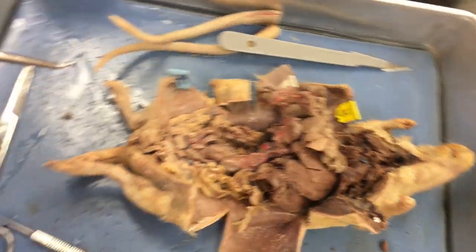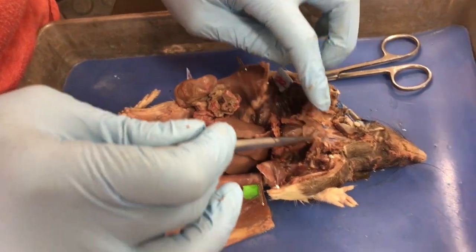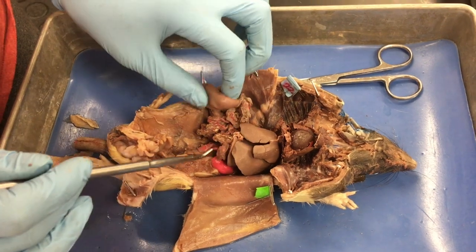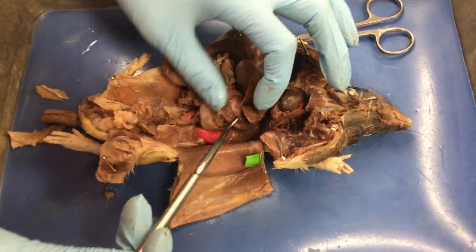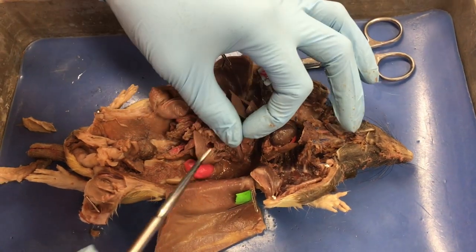Oh, wow. So now let's go to our boy. So the structures that we looked at before, as far as the trachea and the thymus gland and the lungs and the liver and all that stuff, still the same. Notice how this guy's stomach is not nearly as pronounced as this one is here. That's just because he didn't eat as soon as the gas came for him.